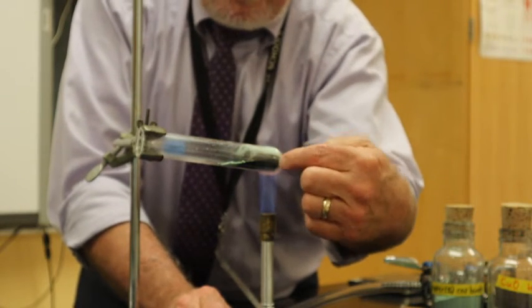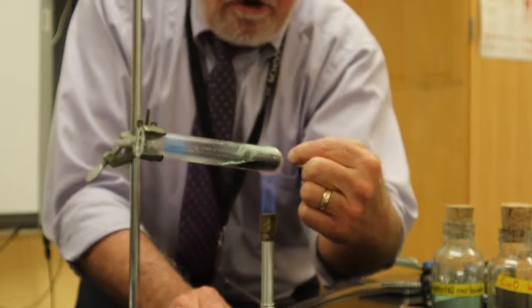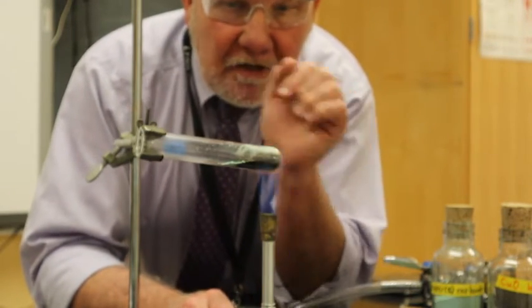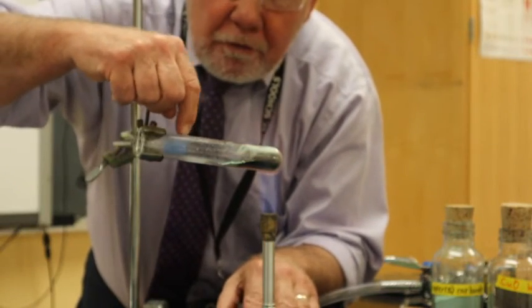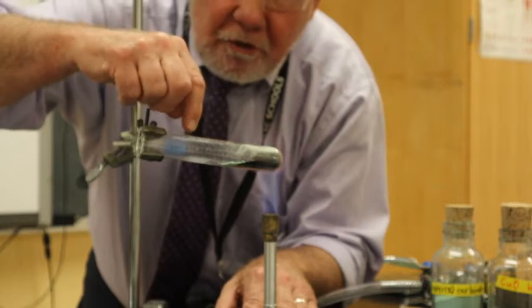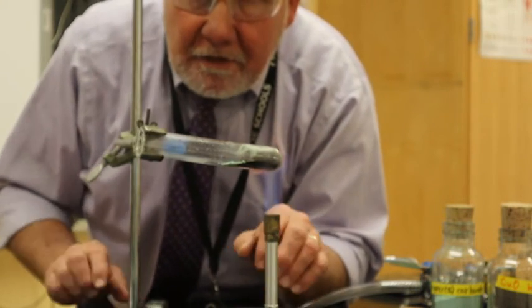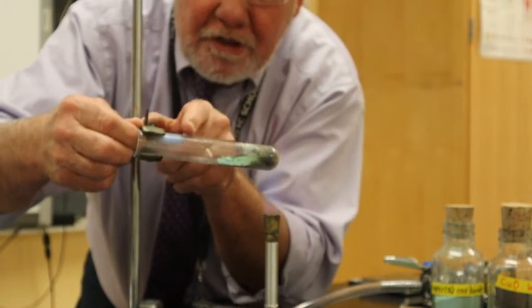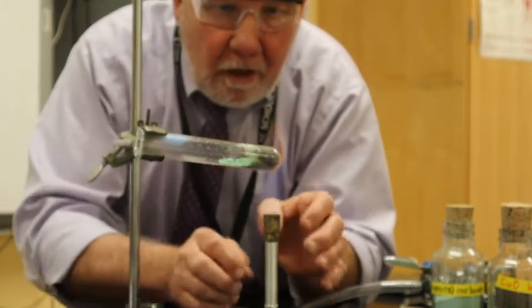All right, so you can start to see that it's turning black here. It's turning black. That's the copper carbonate decomposing, breaking down and making copper oxide. Interesting, I don't know if you can see this, but up here, there looks like there's some water moisture. It looks like water vapor coming off. So that's interesting. I'm going to turn this for you to see a little bit better. Right in this area here, there's a whole bunch of what looks like water.